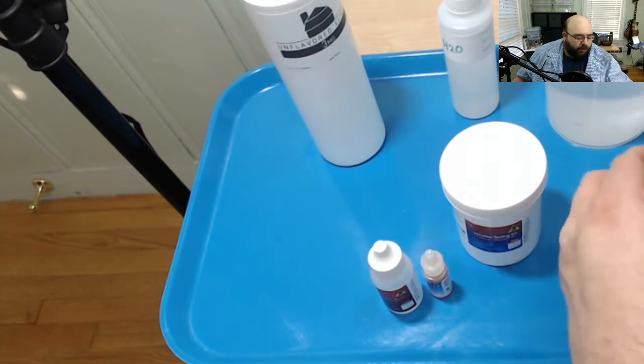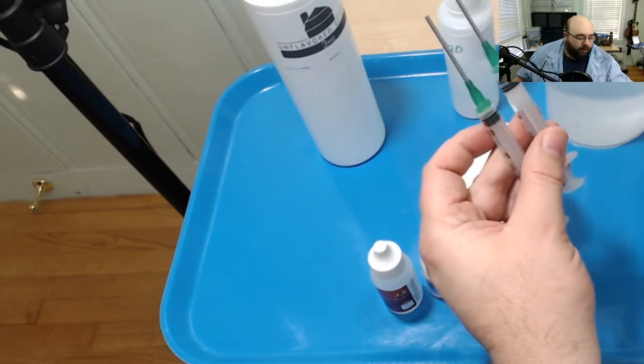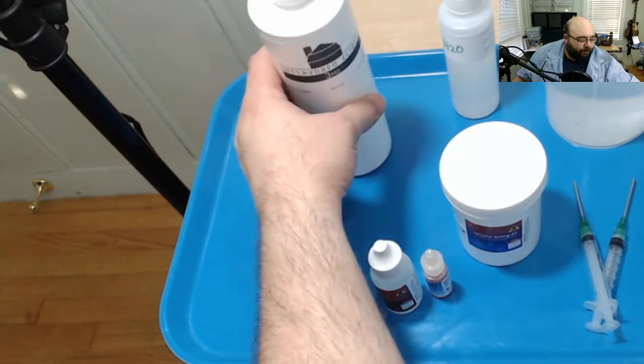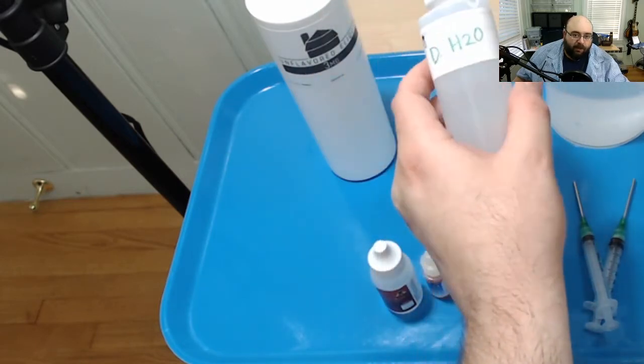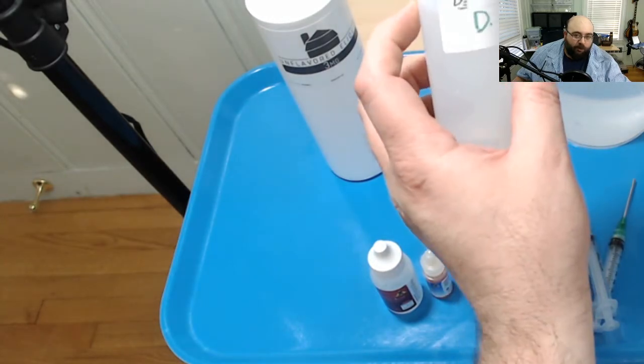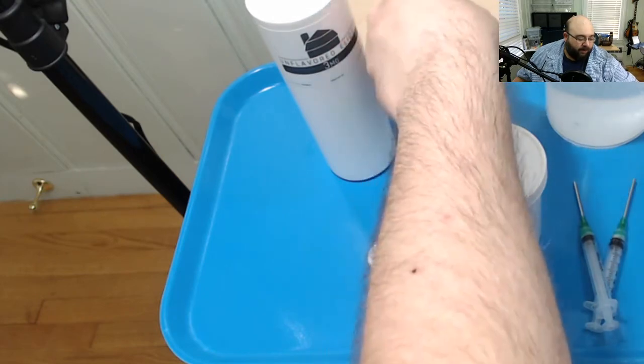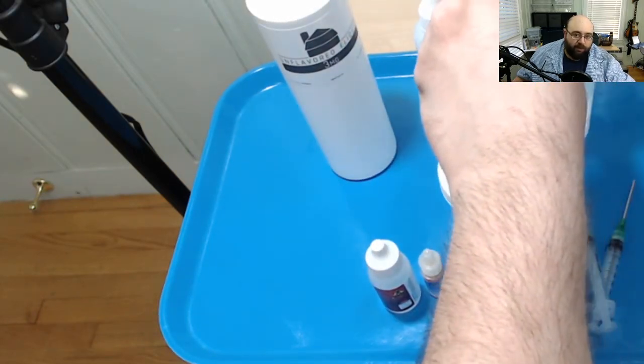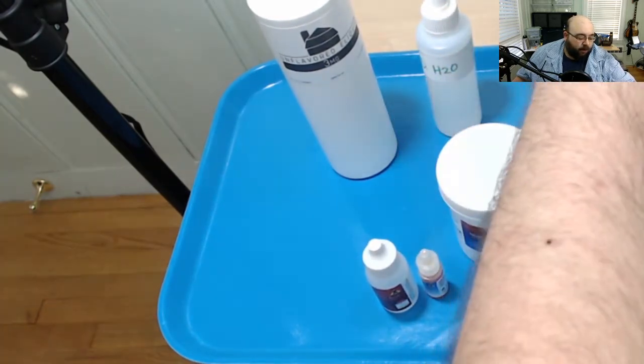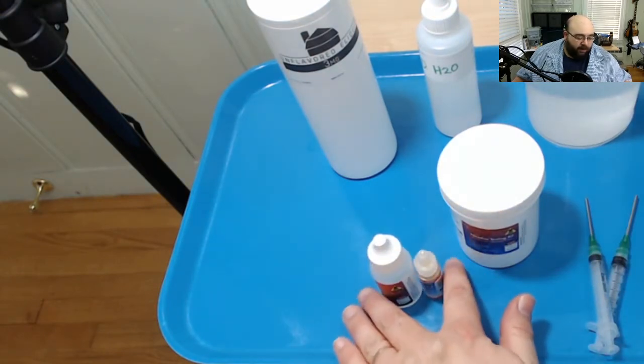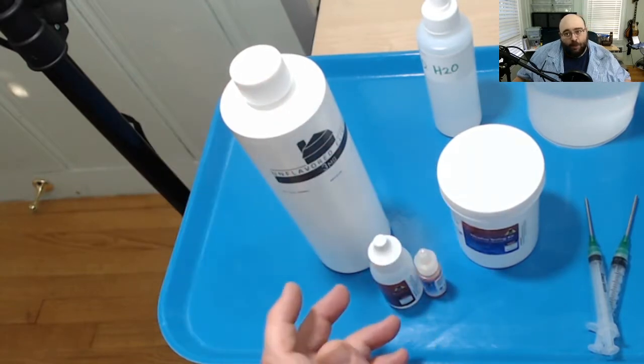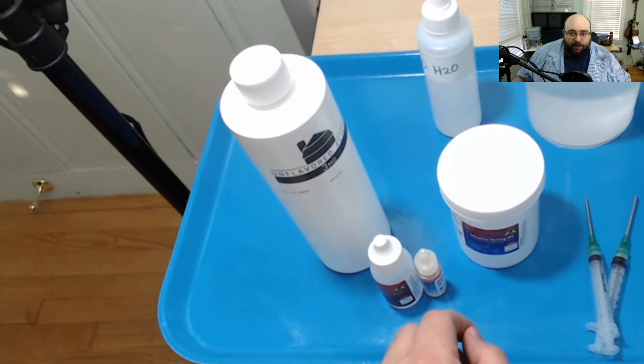I've got two syringes. I don't know if a syringe came with the kit or not but they're relatively easy to come up with. These are three mill syringes. I've got the actual nicotine I'm testing here from Liquid Barn. I've got a container of distilled water, just stuff you can buy at a grocery store or drugstore. And I've also got this large container of just tap water, about a liter of it. It's there to dilute things. What I'm working with here, both of these are technically toxic as is this one. None of them are very toxic but being able to clean up quickly is an important thing for me.